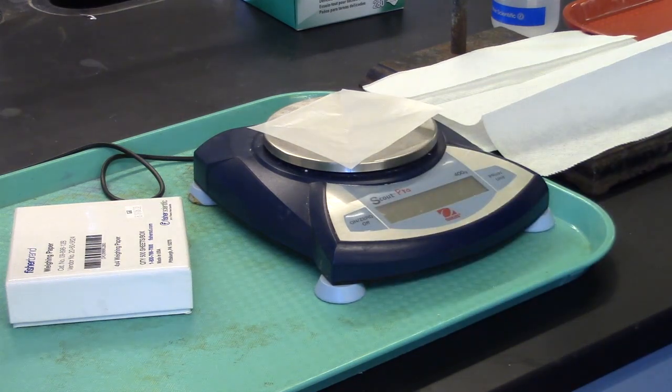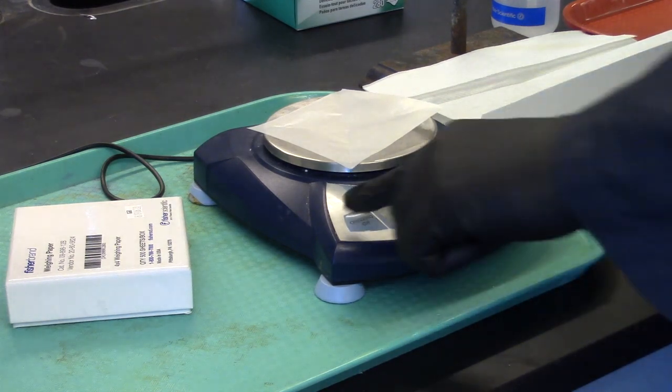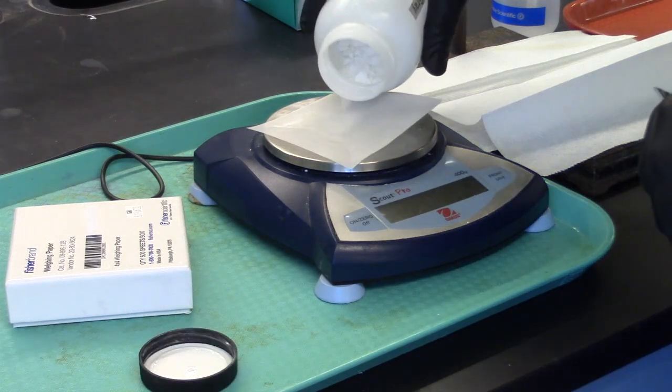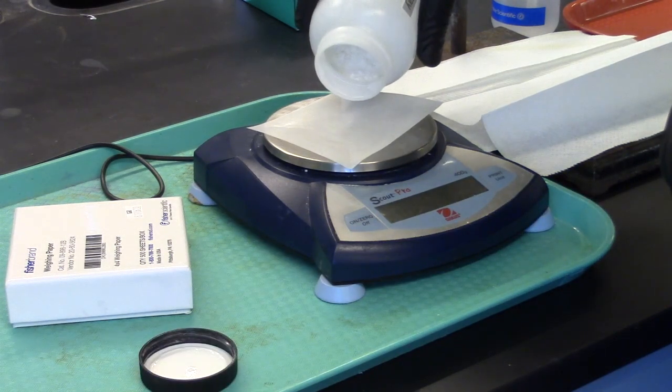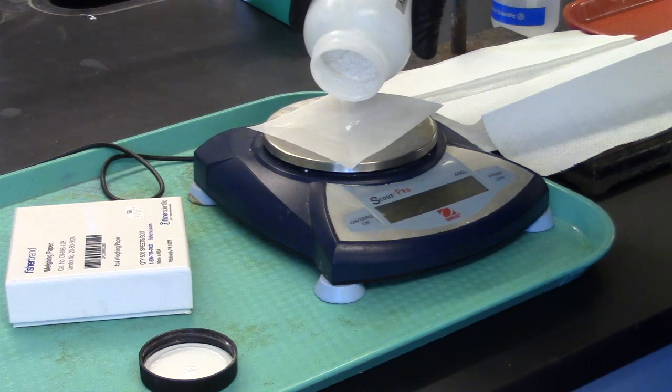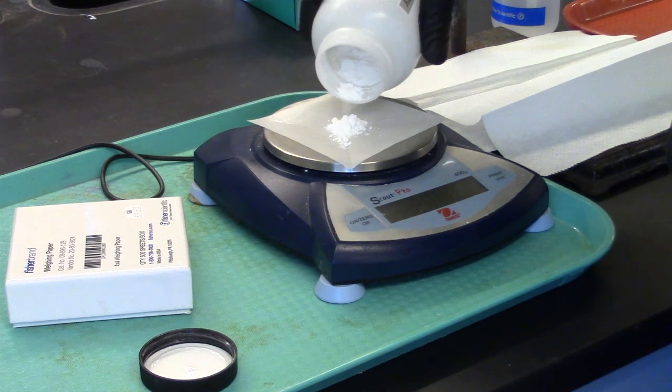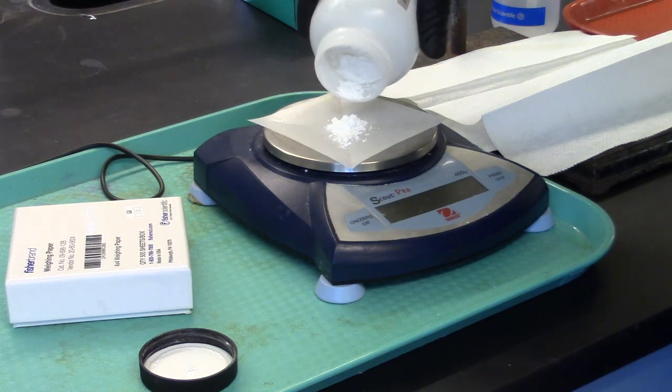Put a piece of weighing paper on the balance, tare, and add potassium acid tartrate until you have six grams. It is not critical that you weigh out six grams accurately or divide it carefully, since solids should be left over when preparing a saturated solution.